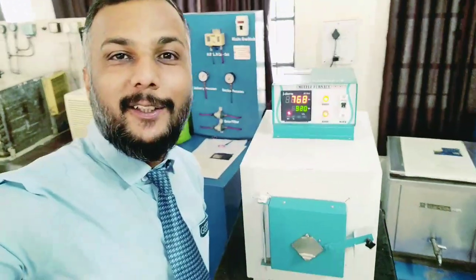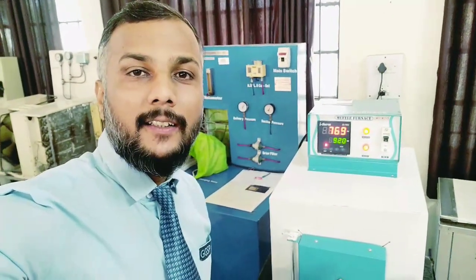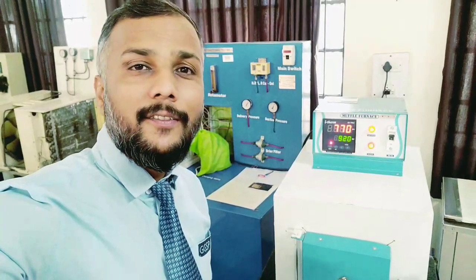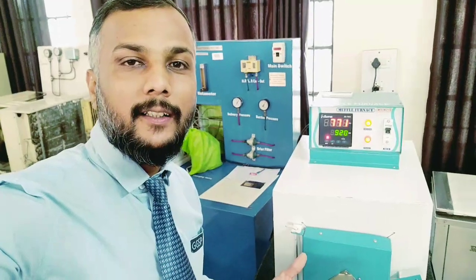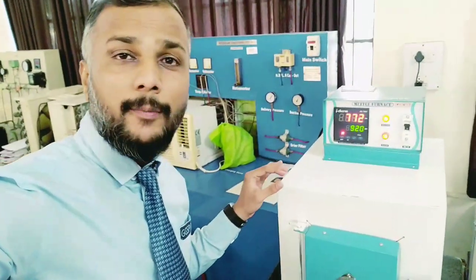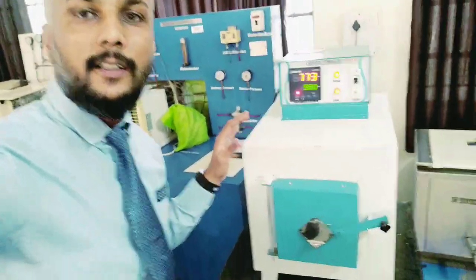Good morning students. Today we are in a mechanical engineering material lab and we are going to see the practical for heat treatment processes. Already we have completed this topic in our theory sessions. Now we are going to perform it in a practical laboratory. You can see here we have a muffle furnace for performing the heat treatment practical.